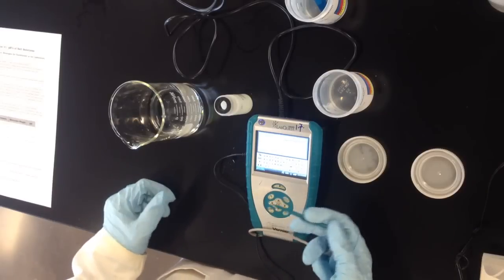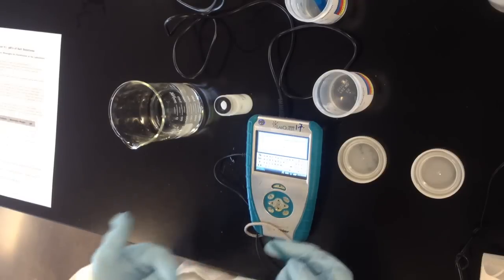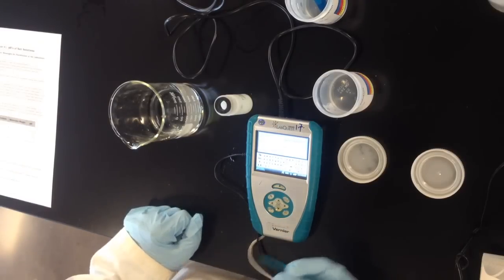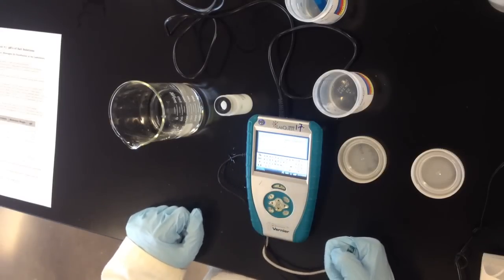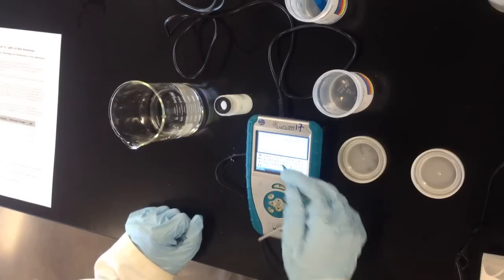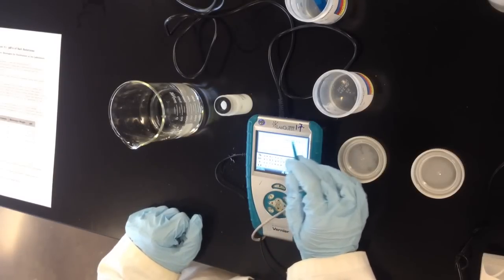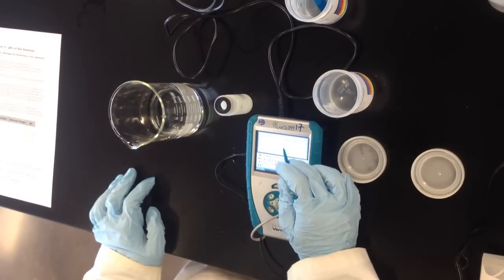So this emphasizes the need to calibrate. There's an indirect or an inverse relationship between the voltage and the pH so we need to tell the LabQuest how this relationship works. So I've already typed in 7.00 here for reading 2 and so I'm going to go ahead and hit keep here. The voltage reading as I can see from the top right is stabilized at about 1.63, 1.64 volts.